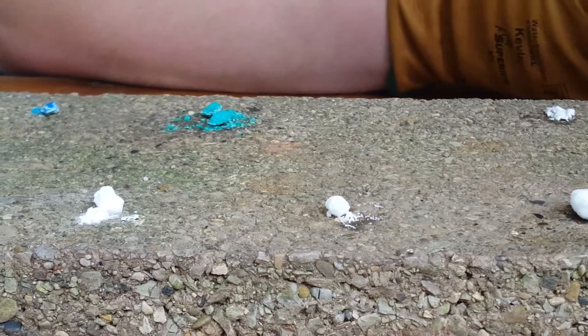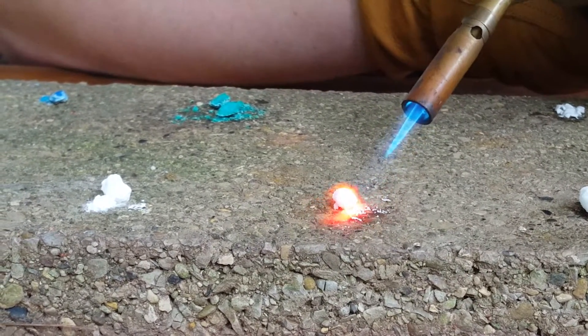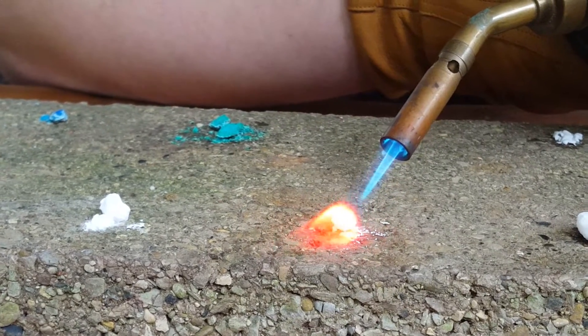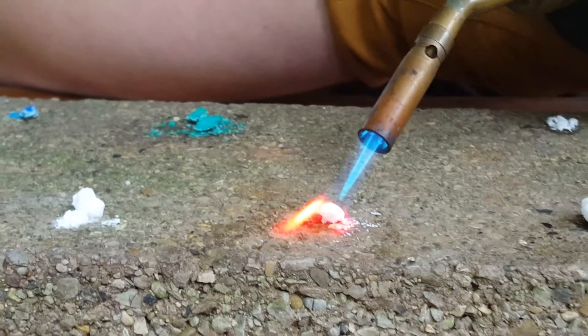This next salt is strontium chloride, and as you can see, it burns with a more red-orange flame than the lithium does.